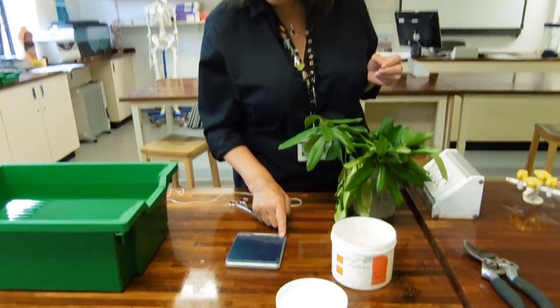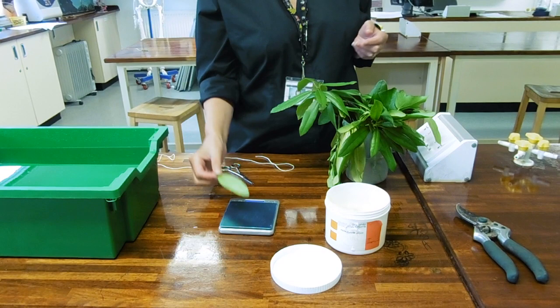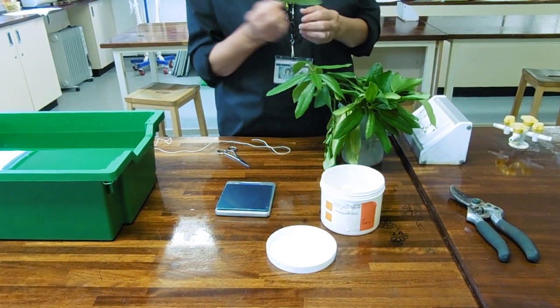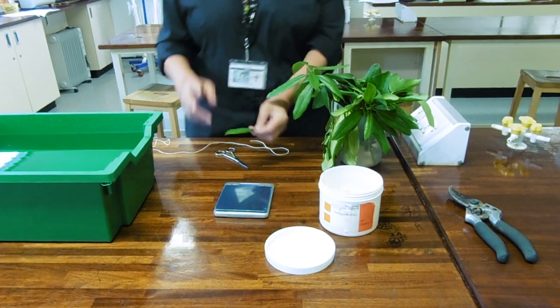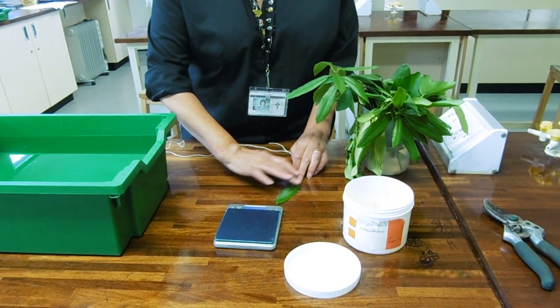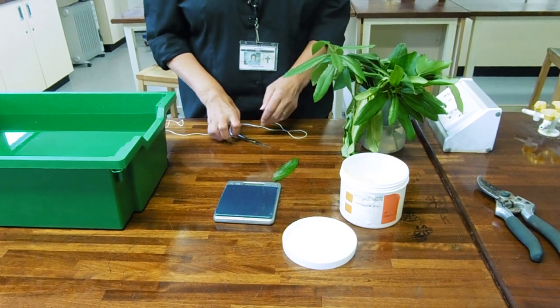I've got my little balance - how cute is that balance? So the principle of the Vaseline experiment is that you weigh the mass of your leaf; mine's 0.63 grams. You remember which leaf it is, and then you apply Vaseline, which is impermeable to water. On one leaf you put it on the upper side, and obviously there are no stomata on your upper side, so we know that one weighs 0.63 grams.